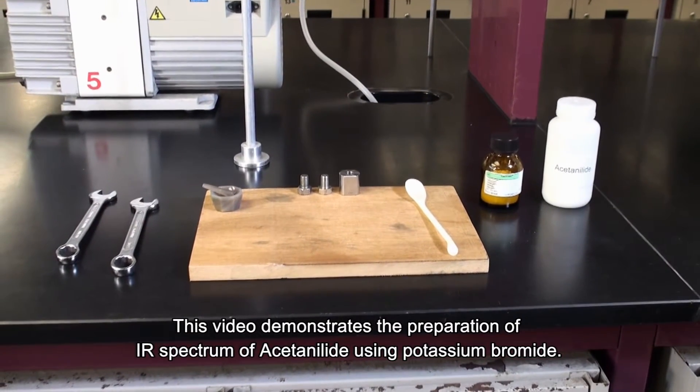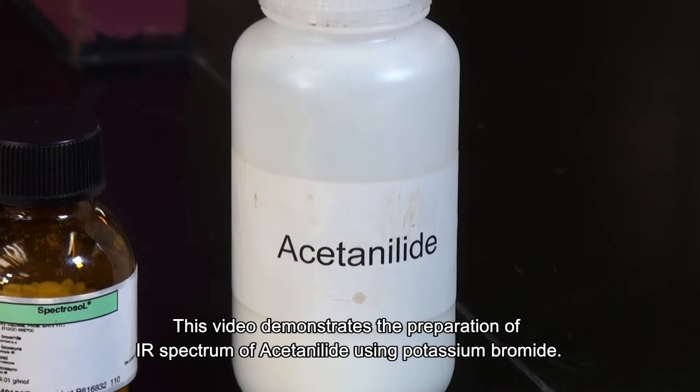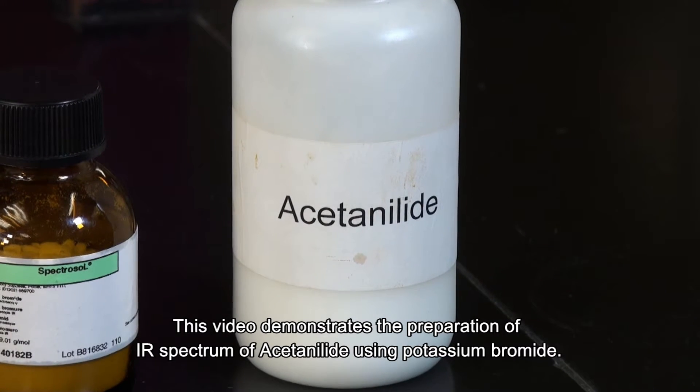This video demonstrates the preparation of IR spectrum of acetanilide using potassium bromide.